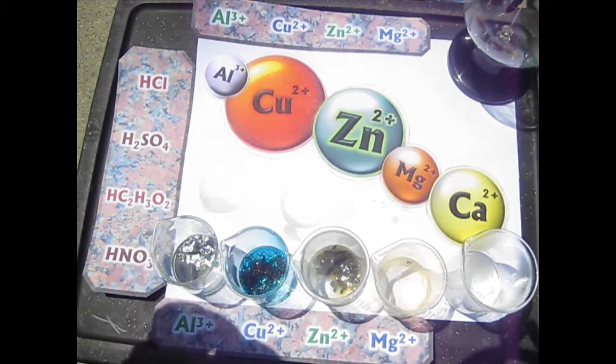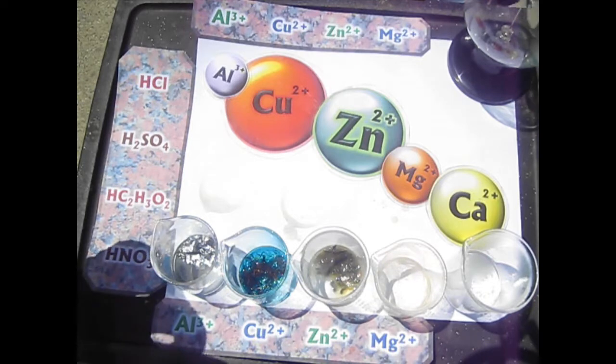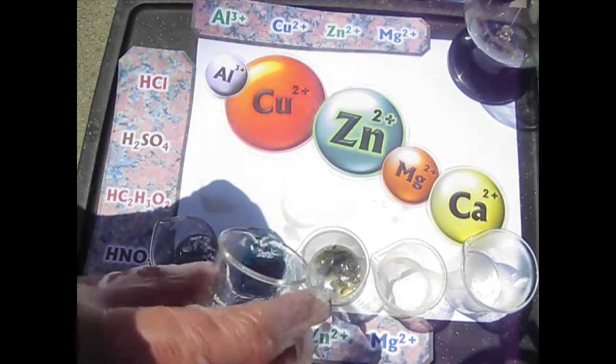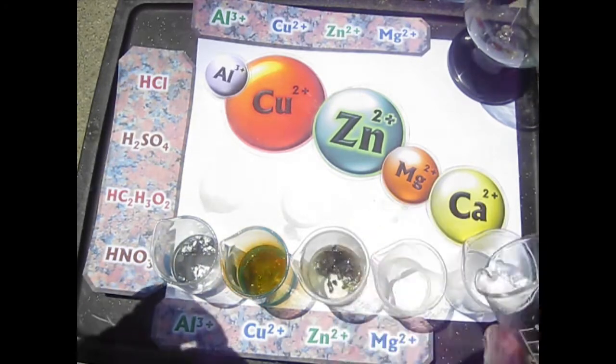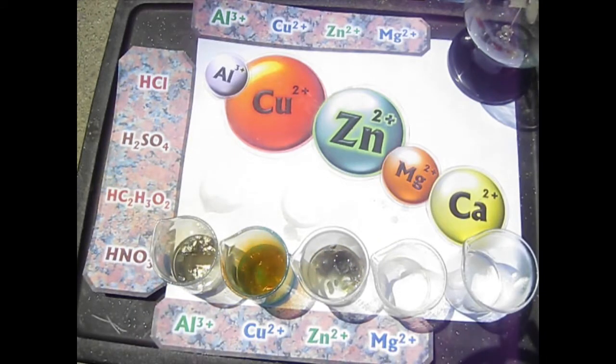And I've got a little bit extra nitric, so I want to sort of get rid of it before I neutralize it. And I'll pour that in there. You never want to leave nitric acid lying around, so I want to sort of neutralize all of this. It can do a lot of nasty things. It does things that no other acid does.